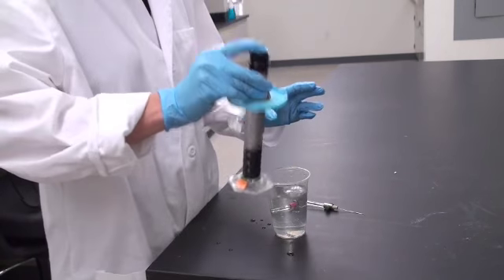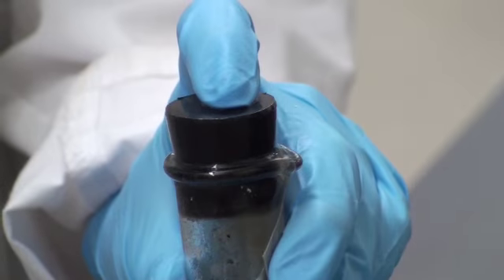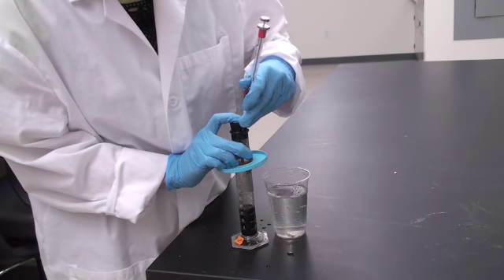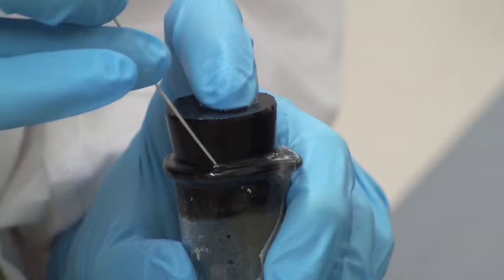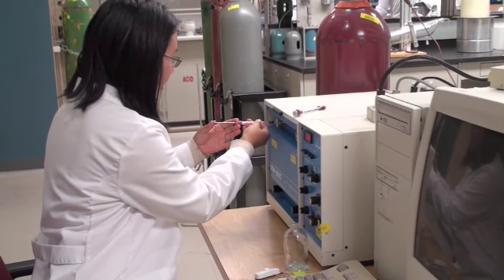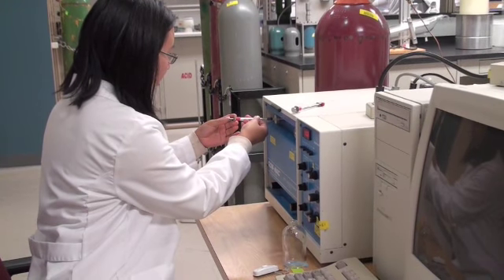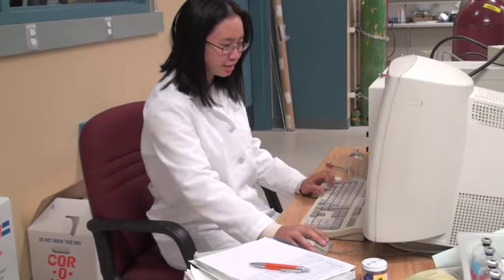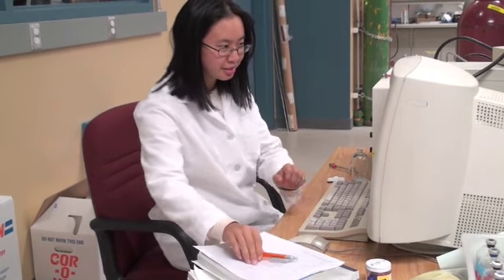If you do have equipment available, you may obtain a gas headspace sample. The graduated cylinder is removed from the cup of water, and keeping a finger on the hole in the stopper, a gas-tight syringe is carefully inserted in between the rubber stopper and the glass graduated cylinder. In this case, the gas sample is inserted into a gas chromatograph, and after running calibration standards, the relative amounts of carbon dioxide and methane are obtained. The gas is analyzed to determine the carbon dioxide and methane composition.